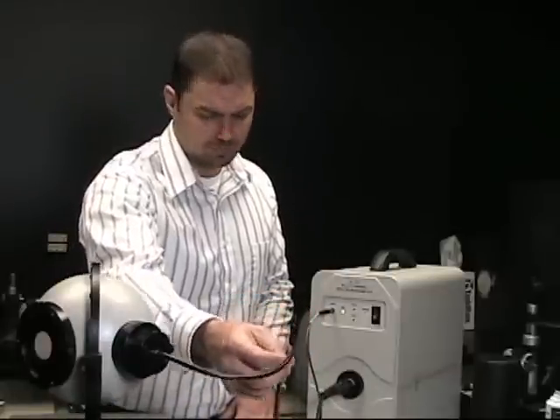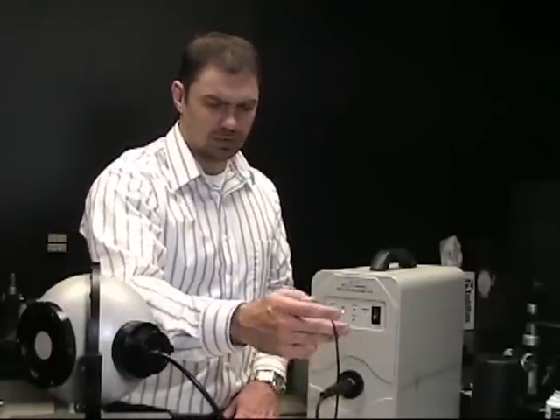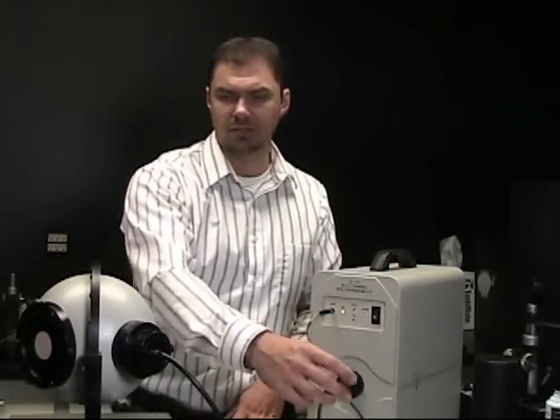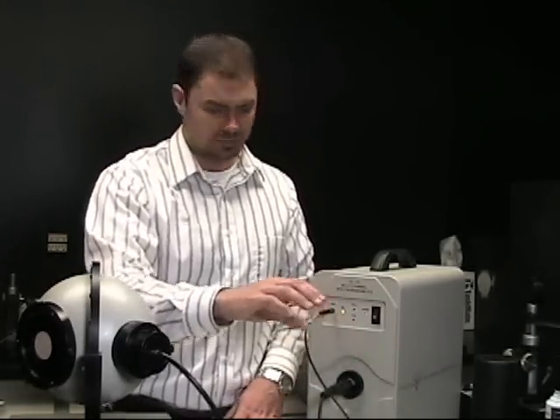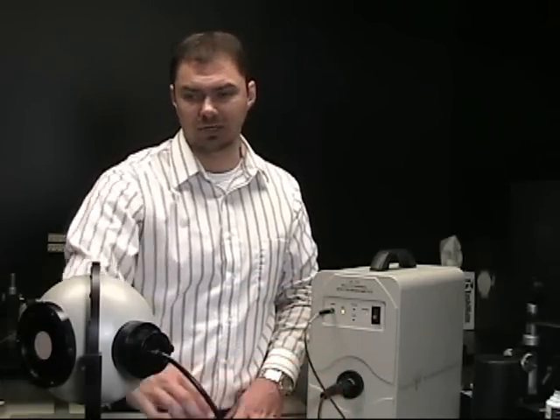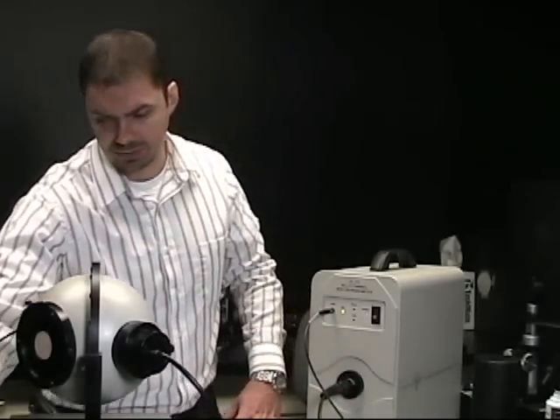I have a 3 millimeter measurement fiber, and also I have our 600 micron internal reference lamp fiber. This is actually the fiber we discussed yesterday that dealt with recalibrating the system for correcting for absorbance of your LED holders.